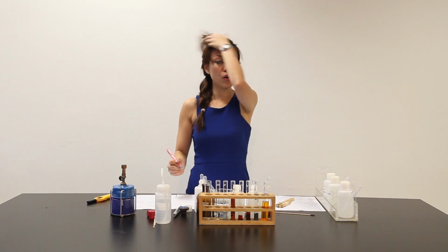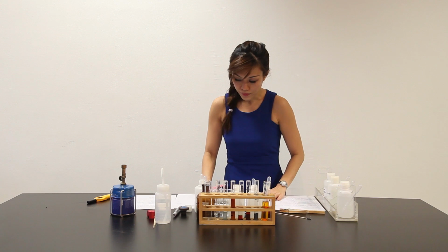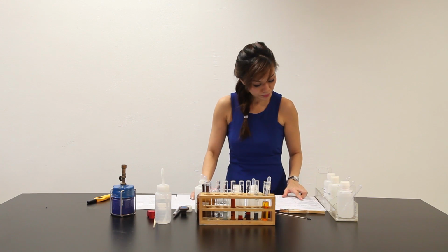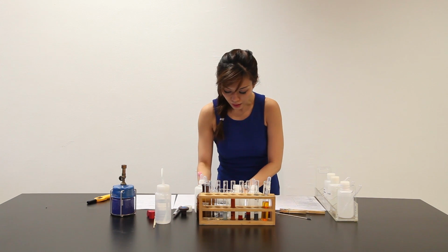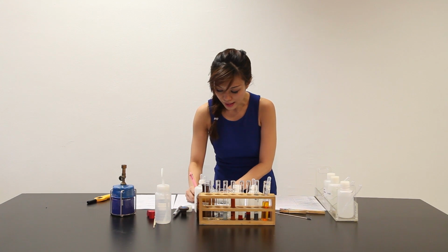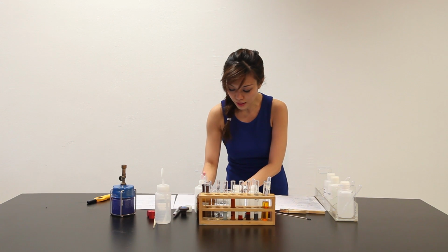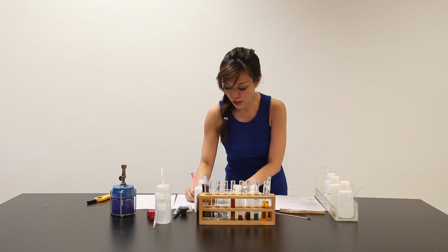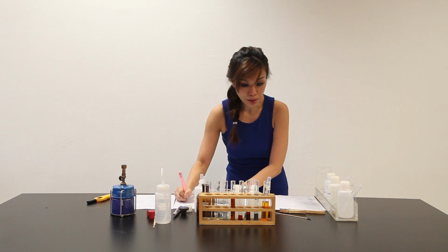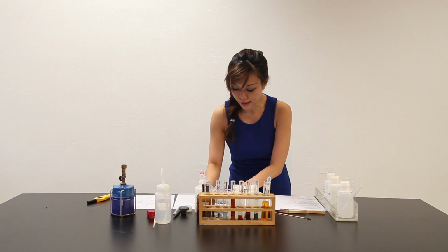Now we left with 2 more conclusions over here. We can safely say that in part B, zinc displaces solution X. Evidence. Part B. Solution change from an orange solution to a clear solution.